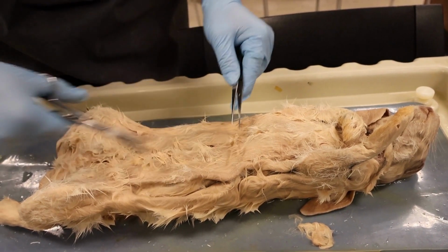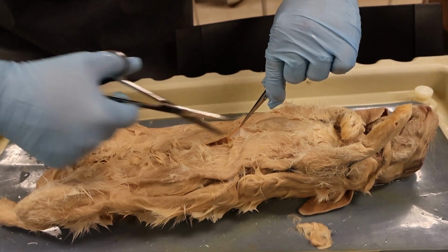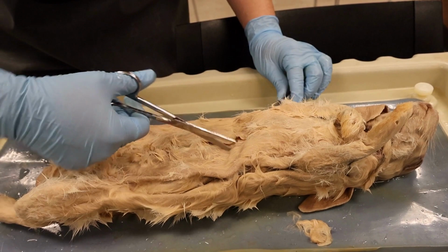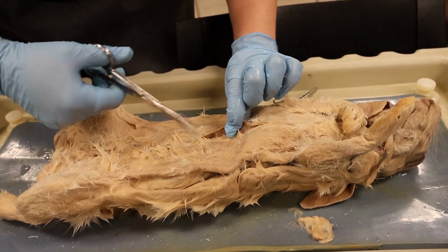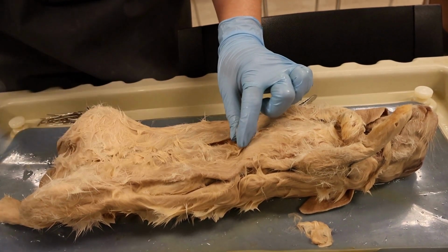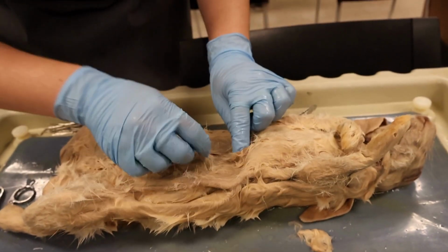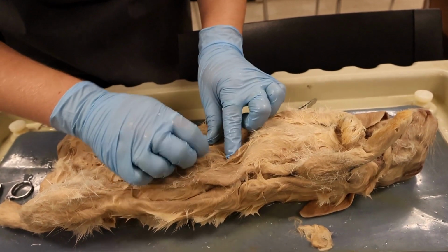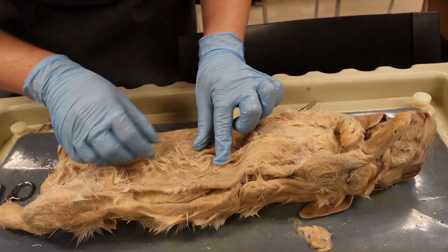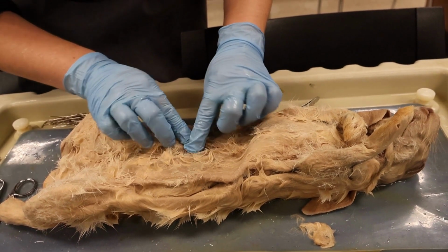So in the second clip, while Emily cuts through the hair and epidermis layer of the rabbit, I did want to discuss this. The integumentary system involves the skin and the hair of a rabbit. Both are incredibly crucial in regulating body temperature in mammals. Especially the hair has internal insulation and a cooling element to it. So no matter the season or the high or low temperature of the environment the rabbit is living in, it can regulate its body temperature, as well as the temperature its internal organs need to maintain homeostasis. The skin is also an external layer that protects the internal organs, along with being a body temperature regulation mechanism.